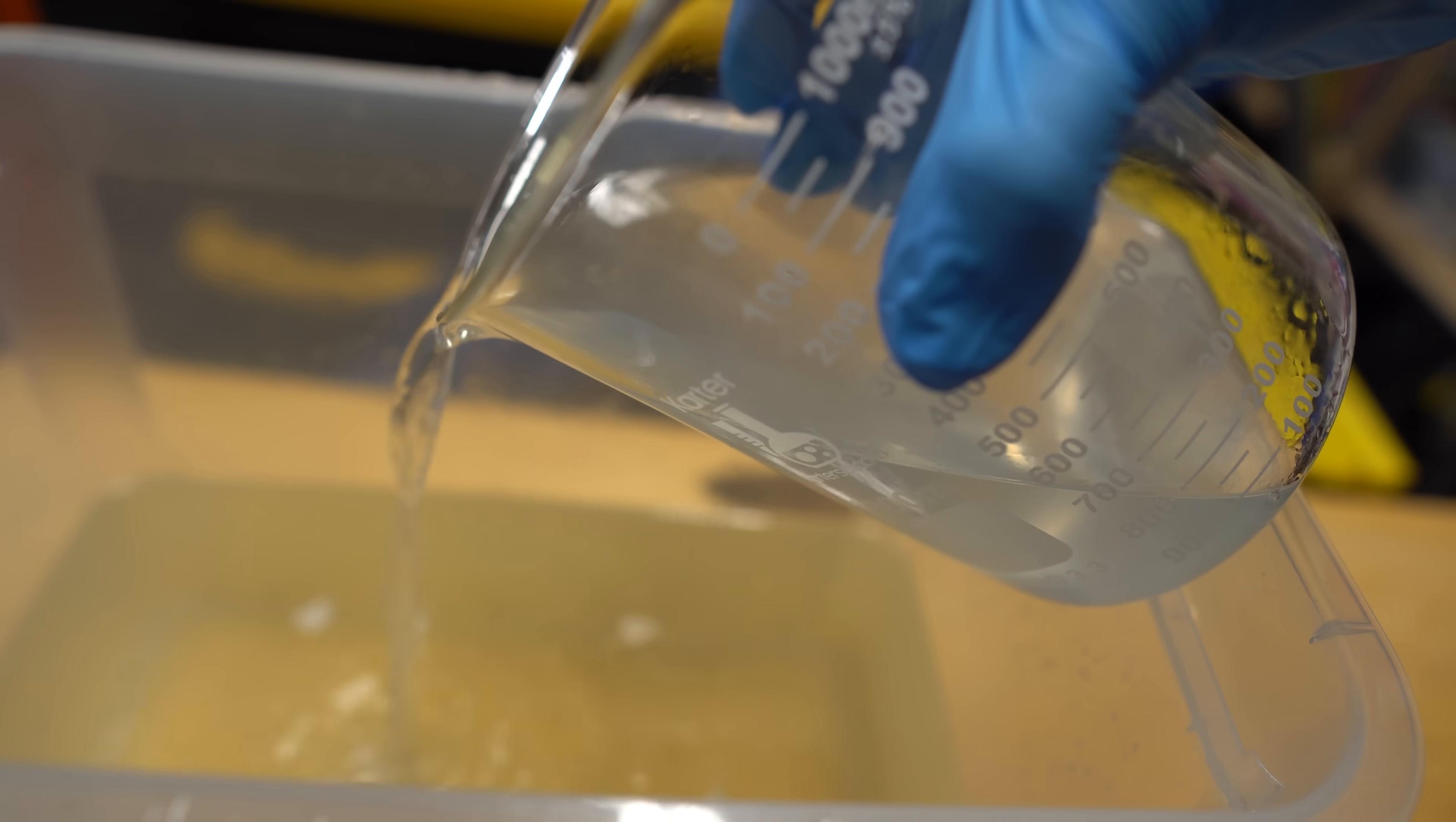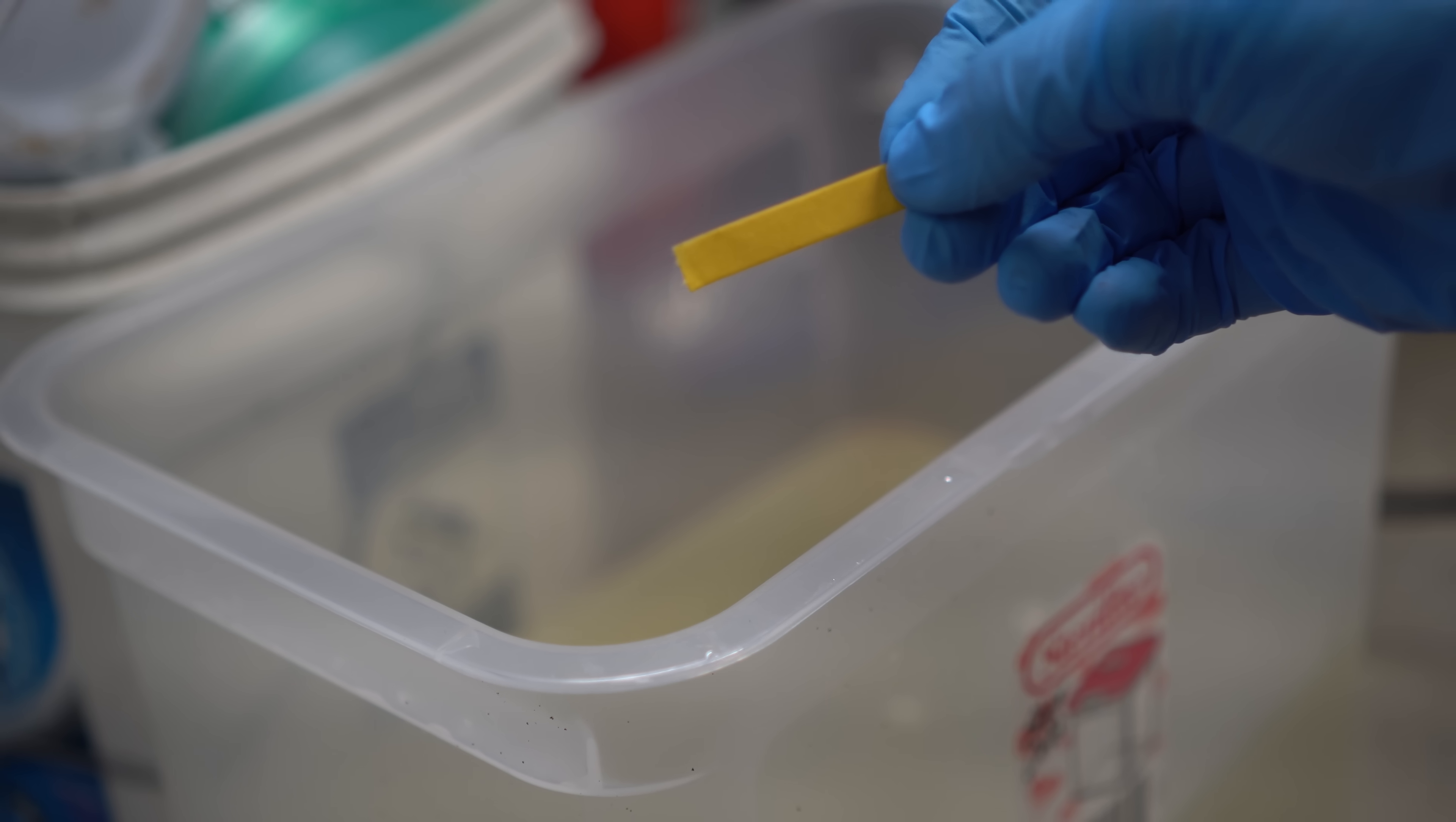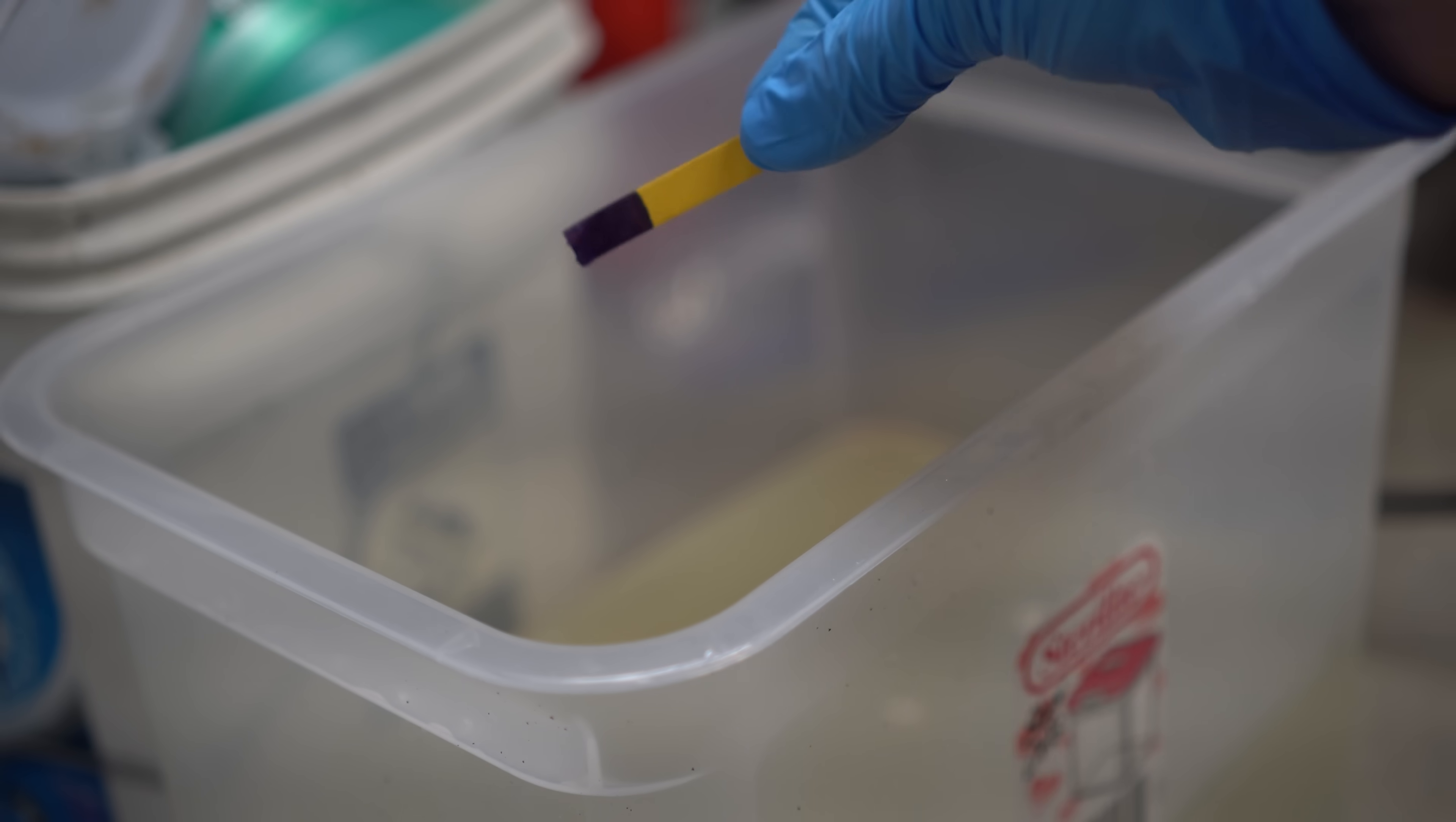All of the bleach and containers washed should be dumped into a waste container. Sodium hydroxide was added to the waste container to destroy any of the chloroform left in solution. You can see here that the solution is extremely basic.